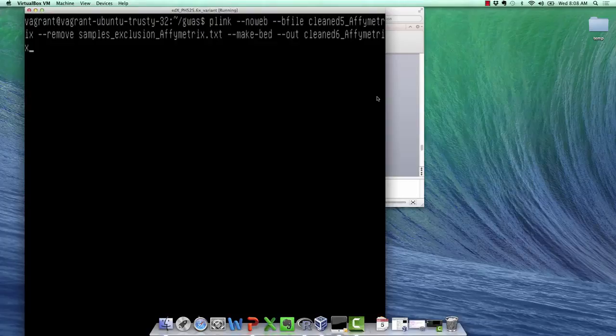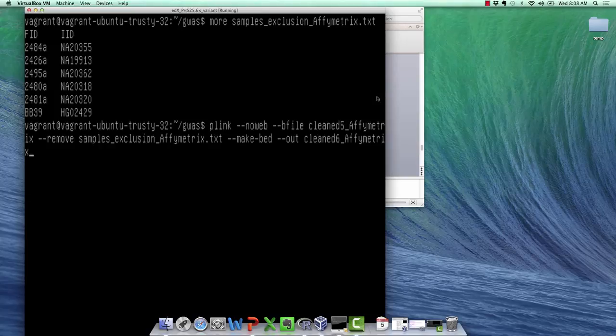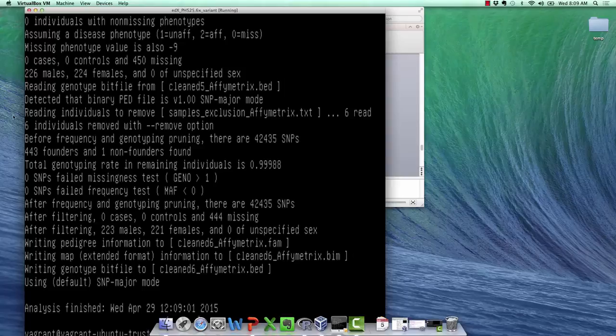So this is what the samples exclusion Affymetrix file looks like. It's just a list of the 6 individuals that we're going to exclude. And we're going to exclude them using the remove command. So remove, and then you just pass the file that lists the individuals you want to remove. And there we go, 6 individuals were removed.